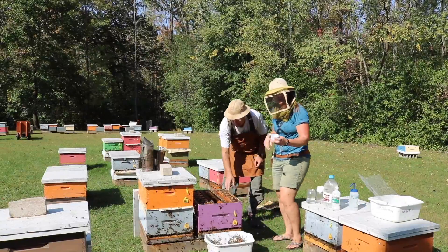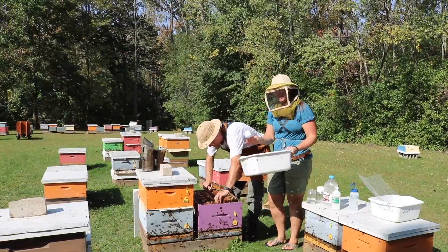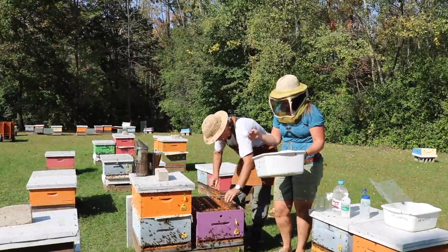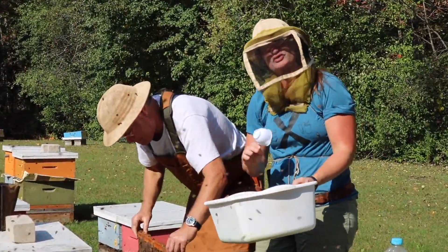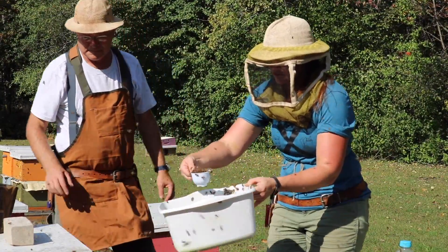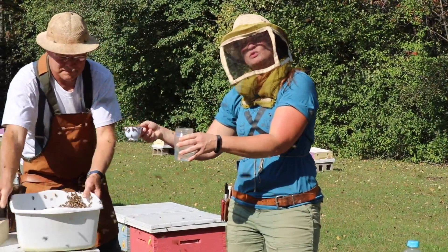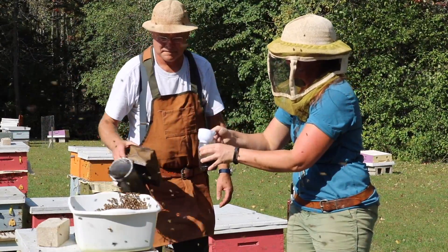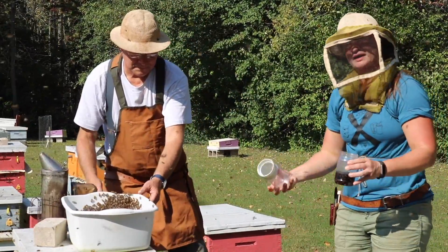I have here a half cup. A half cup of bees is approximately 300 bees, and so that gives you a good estimate of what's happening inside the hive. Right now there's probably 30,000 to 40,000 bees in the hive, so 300 is a very small amount. You want a level scoop — make sure you don't have a heaping or too low amount. You have your 70% alcohol ready and the bees will go inside. The rest of the bees can go back into the colony.